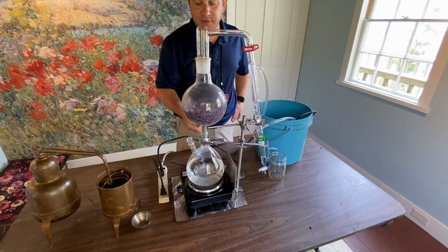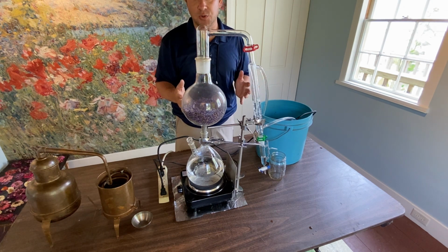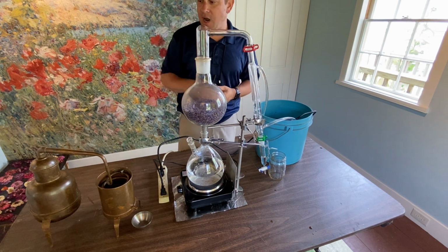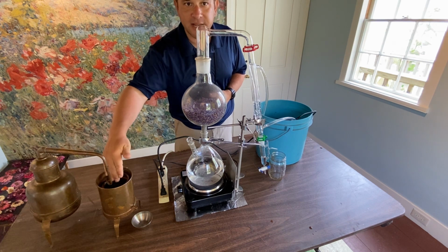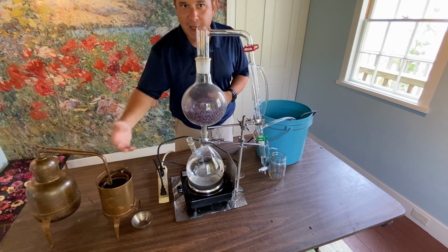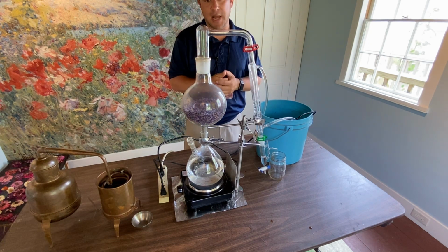This is why I love the borosilicate still compared to the alembic copper still. This system on your right is super easy to use, very easy to clean. Once it's set up, you can kind of step away and it does everything by itself. Unlike the alembic copper still, you really have to watch it. You have to replace the cold water that accumulates around the condenser because it gets really hot. So this traditionally was right beside you as you were preparing other things. These modern types of stills, really easy to use if you want to invest in this type of equipment.